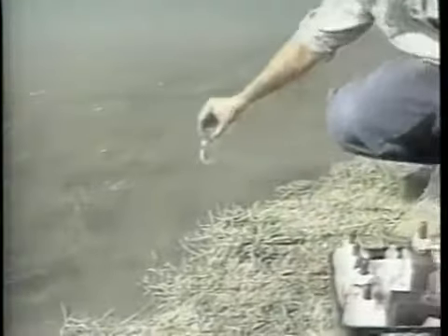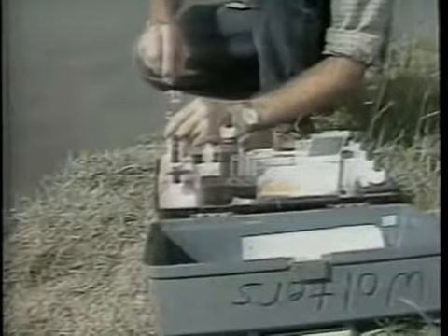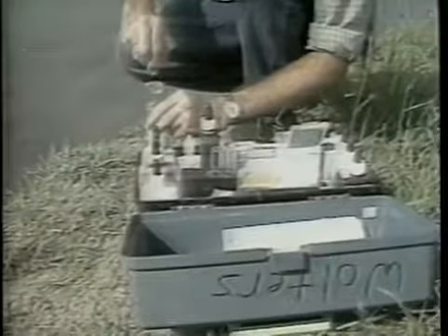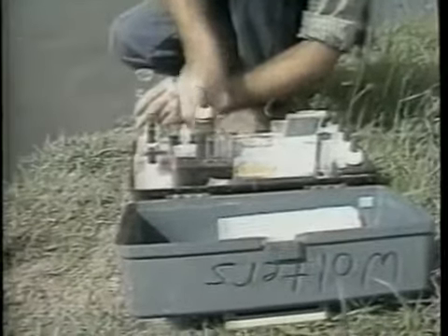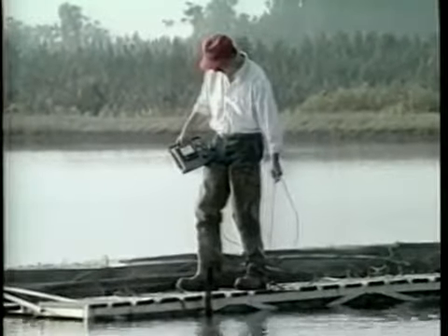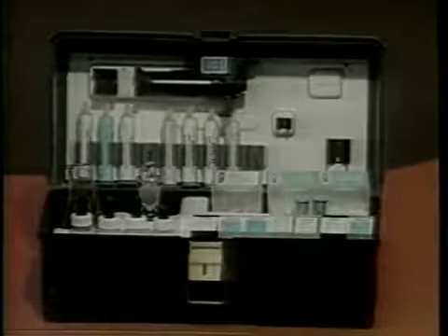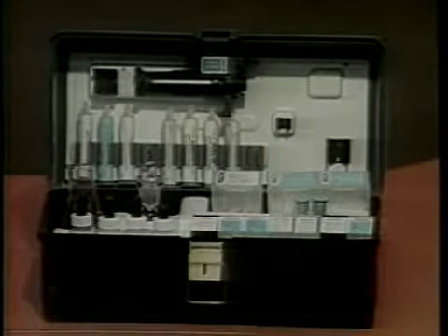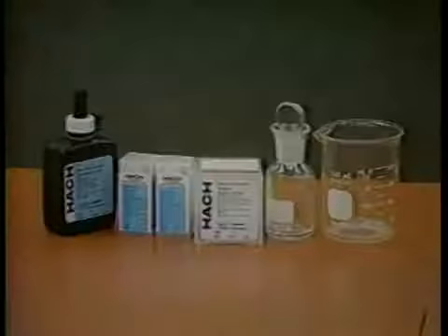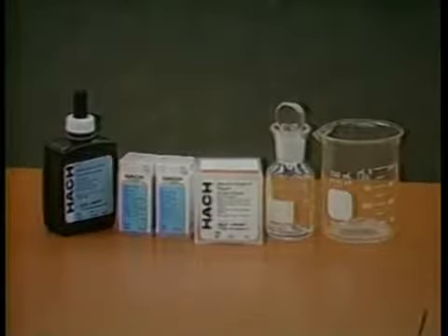There are two methods of dissolved oxygen determination: the use of chemical kits and polarographic meters. The kit method is usually more practical for a small producer or pond owner, while the use of meters is usually preferred on larger commercial operations. Kits may be purchased from scientific supply companies or from fish farming supply houses. Included in the test kits are a high-range and low-range method for dissolved oxygen determination. Initial testing should start with the high-range method.